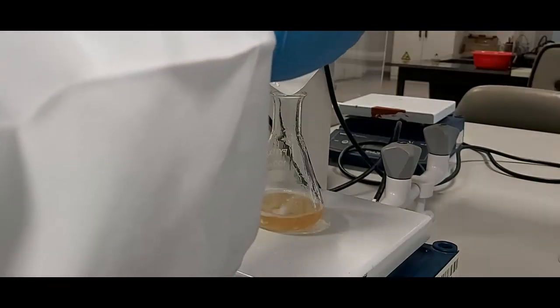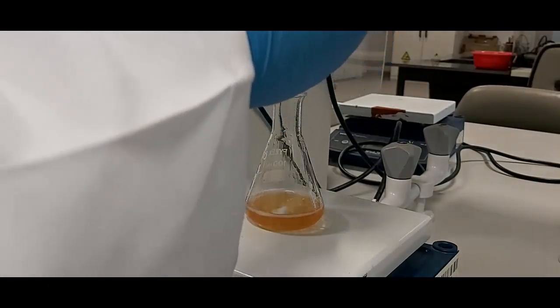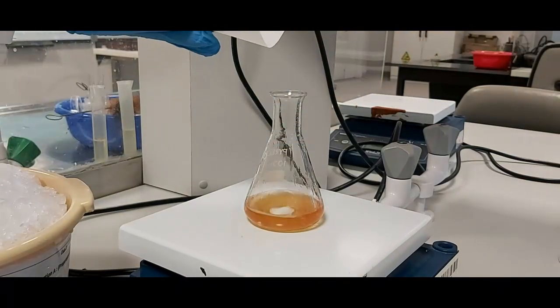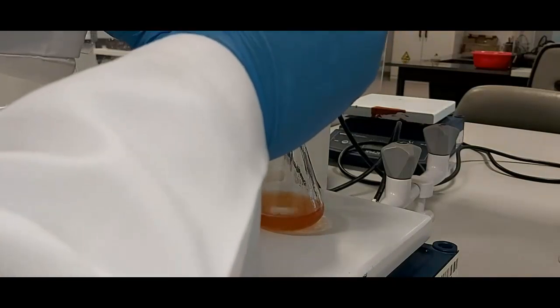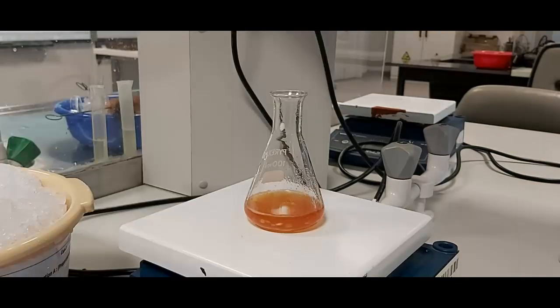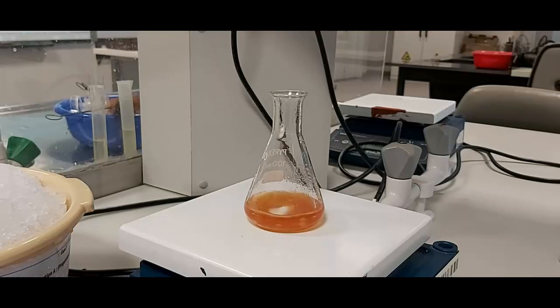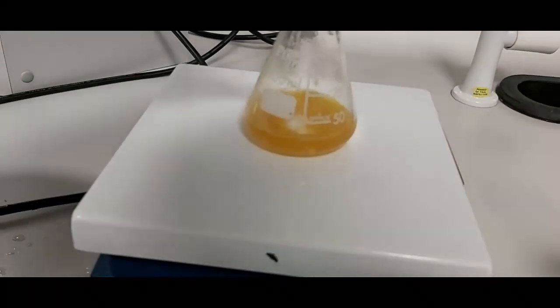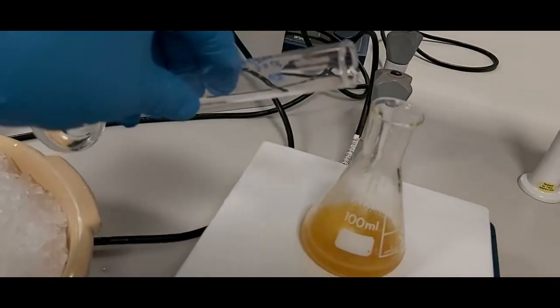I will add the sodium borohydride in a portionwise manner. As you can see, the reaction starts to change color, indicating that the reaction is working. We keep the reaction going for 15 minutes. Once the time is finished, we add water to the reaction.